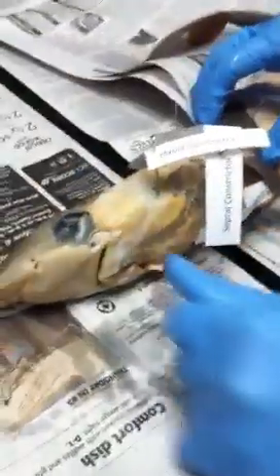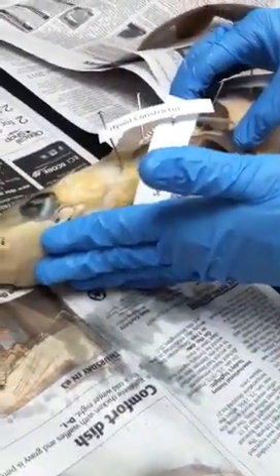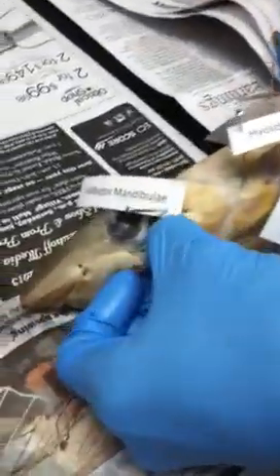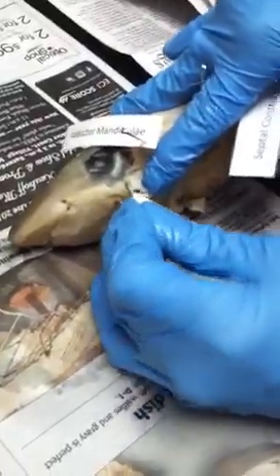See the big cheek muscle? That big circle is going to be the adductor mandibulae — think mandible is your lower jaw, so this muscle is responsible for closing the jaw. I pin that right there. While I'm there, I go below the eye — there's a muscle below here that's called the pre-orbitalis. Think eye orbit. As long as I go below the eye, I'm getting that cylindrical muscle — the pre-orbitalis.